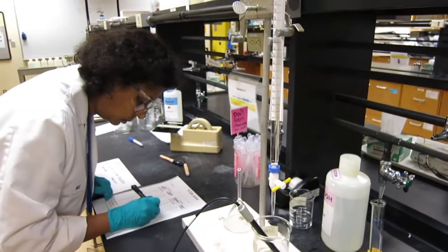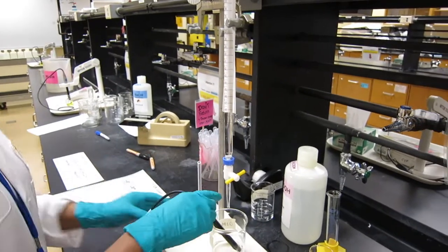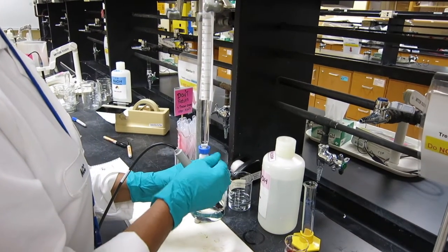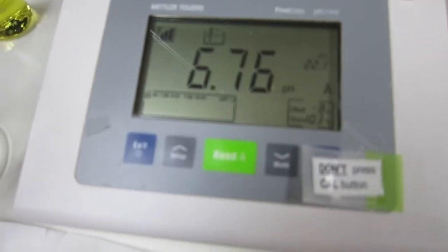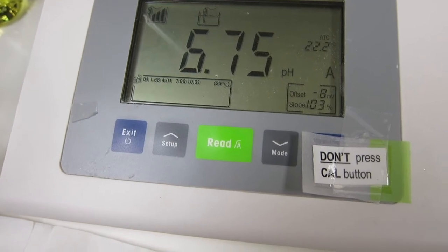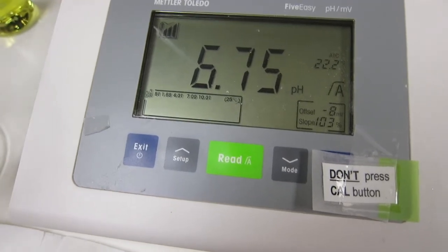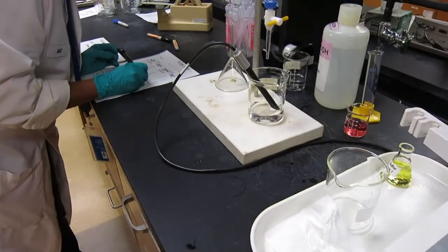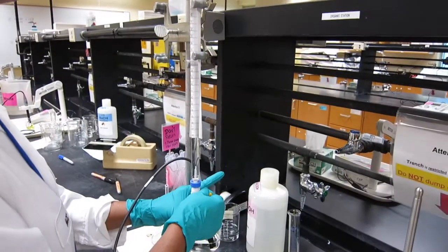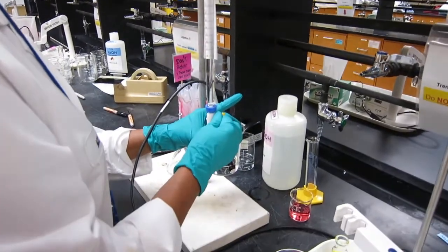Now at 23 mL. Dispensing one more mL — 24 mL. The pH is 6.75.